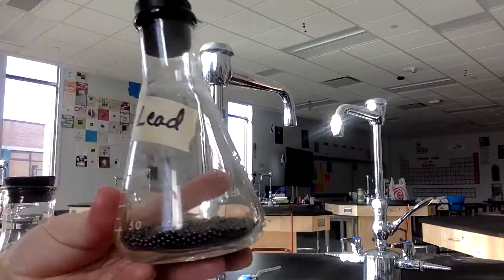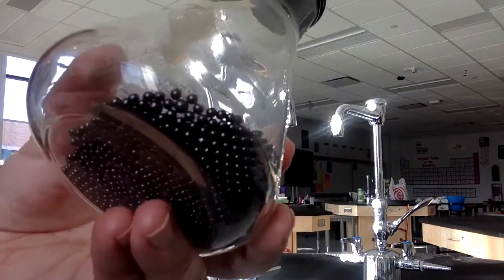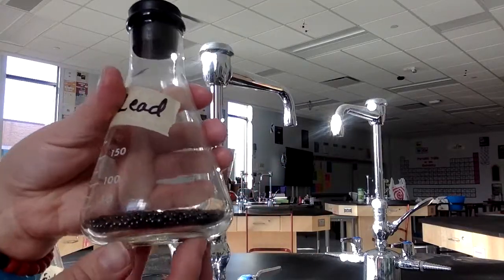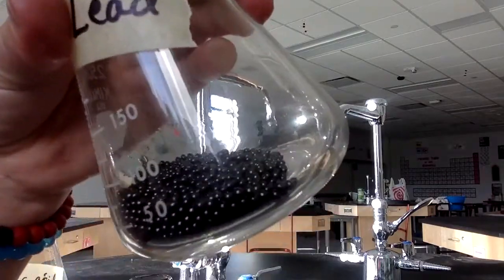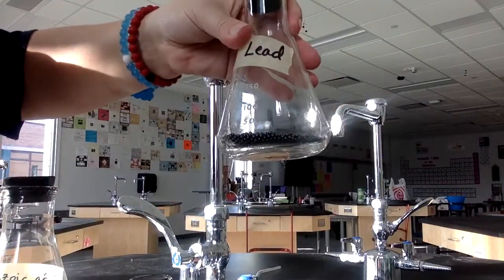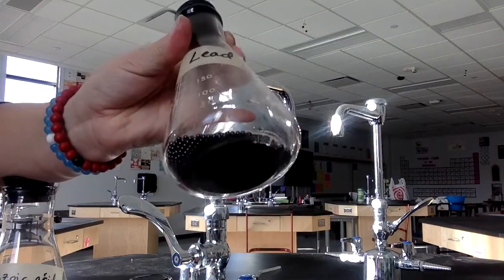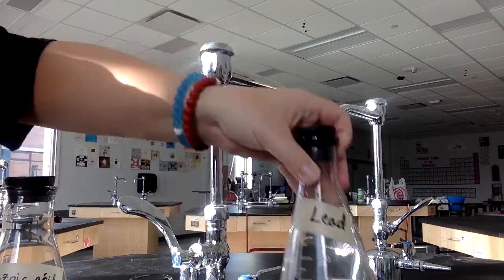The mass you will get from the periodic table, but you can see that they're like little circles, little beads kind of. It is pretty heavy just because the lead sample is lots of particles packed in a little space. And you can see that they're little kind of blackish gray little beads. And again, the sample size is small. It's less than 50 milliliters, and that's your lead. So then you have to decide, okay, so is this an atom, a molecule, or a formula unit? So that's part of what we're reviewing today.